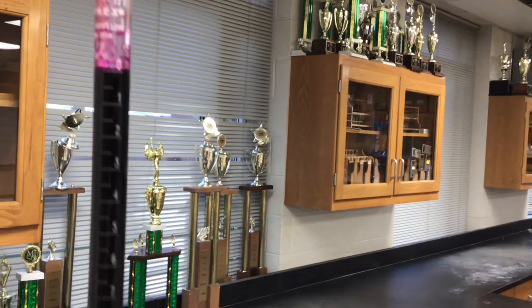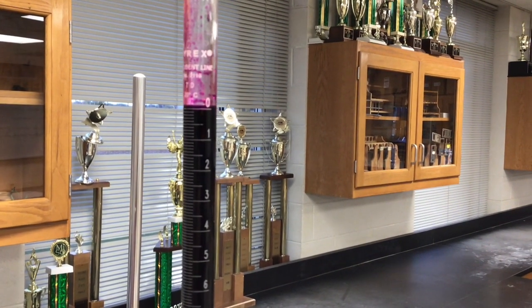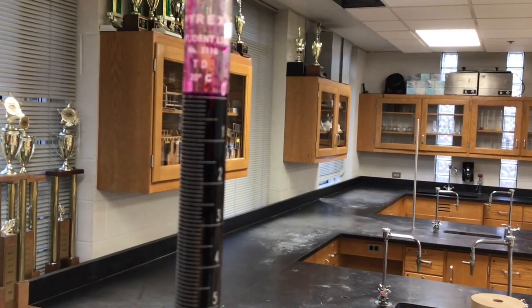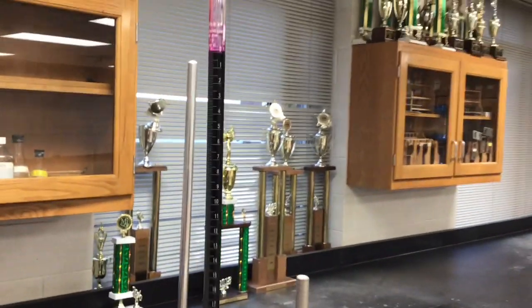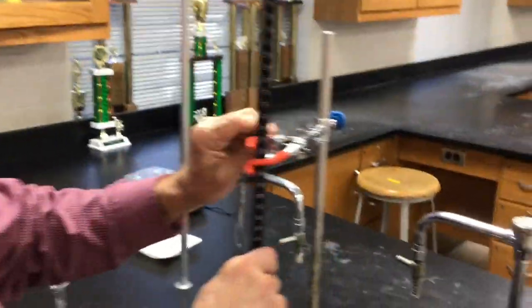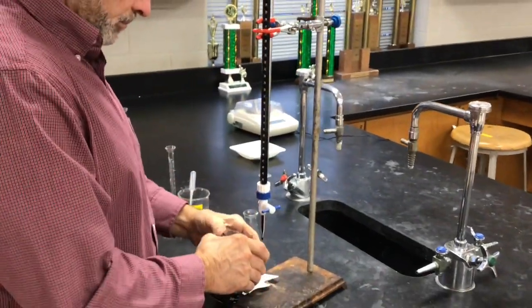I guess I thought when I filled it, it was right on the line. It's hard to measure the permanganate because it's so deep in color, you can't really see through it to see the meniscus. So I guess we're stuck kind of just looking at the edge of it. But let's run some out of it. Okay. Well, you don't have to take it out, just put a drop into there.